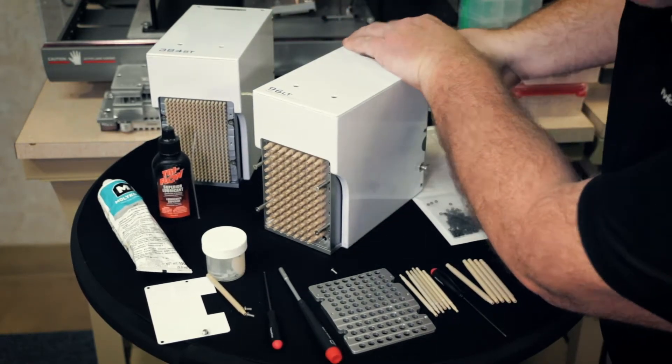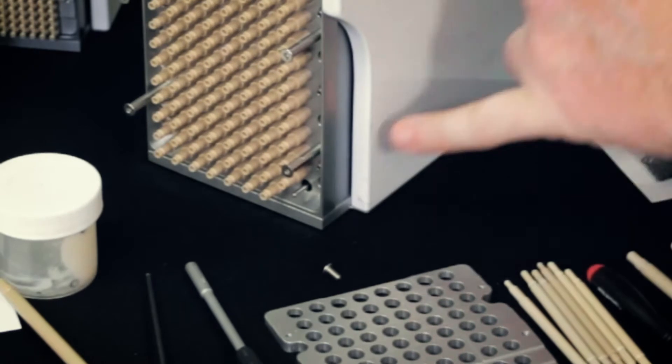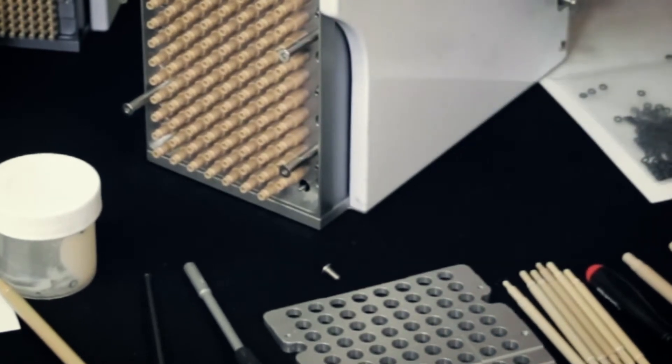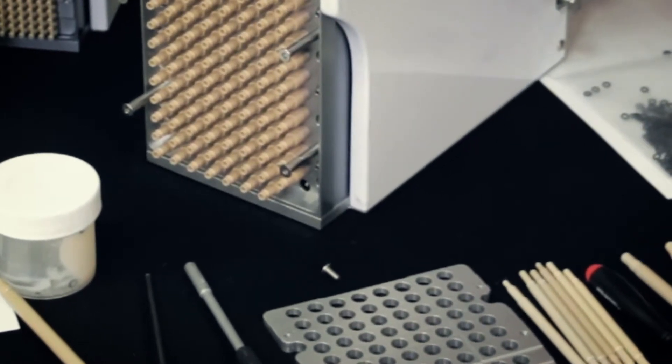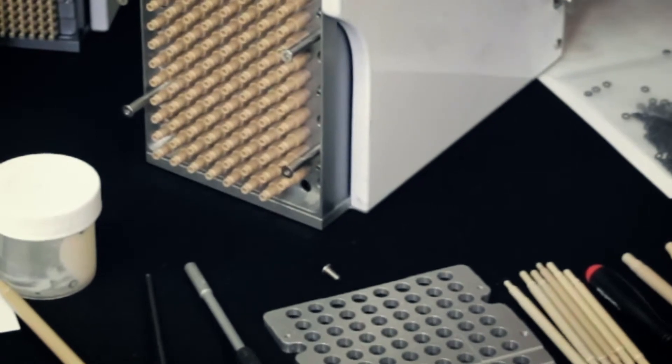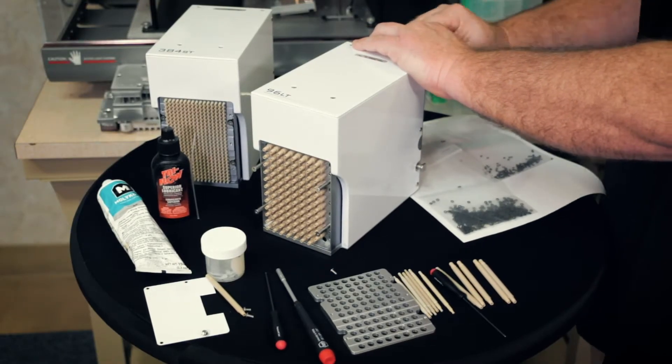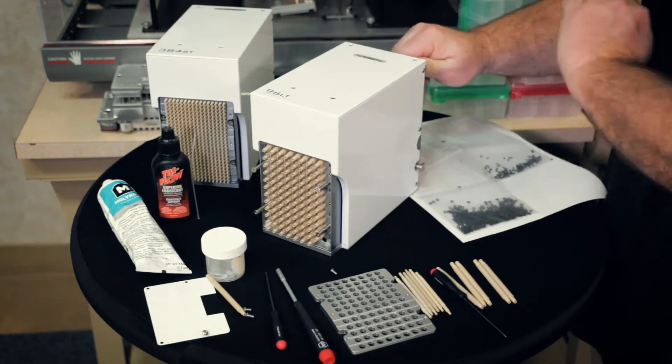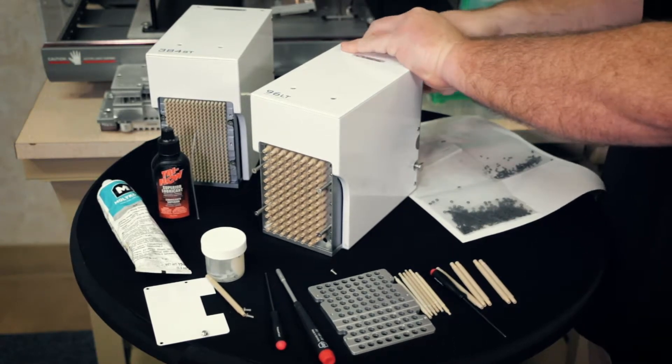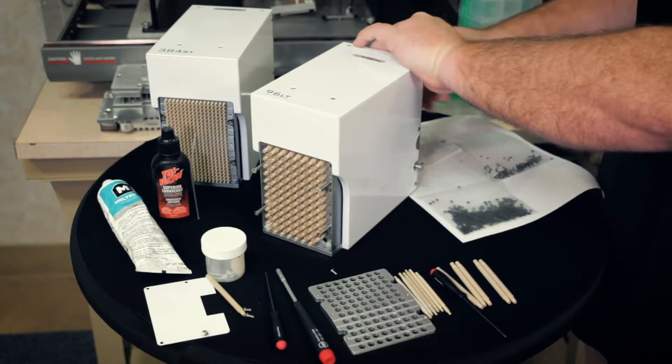We're going to need to bottom this out. So just screw clockwise all the way down until it bottoms out. So once it bottoms out, go in the opposite direction, counterclockwise, all the way up.